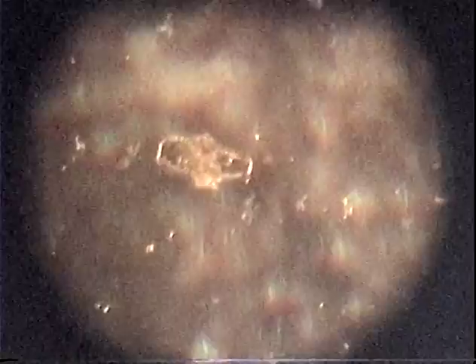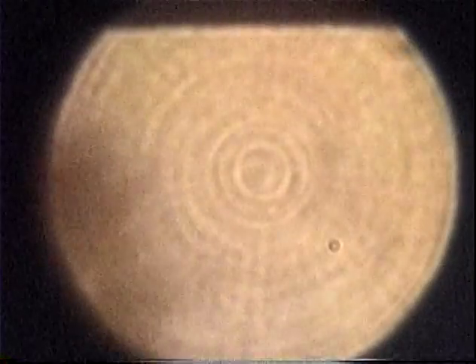It's gone. Let me go back to the lower part here. Dude, that looks like a whale. Look at that thing. That thing's just a bunch of moving algae. Where did that go? We want to see that again. That is something, guys. That big clump of algae has something underneath it. It's very interesting. Looks like a whale. What is this thing, guys? Yeah, it's moving. I'm curious what that is. This thing is two little worms. So, hey, I need a top for it. And I'm getting another slide.